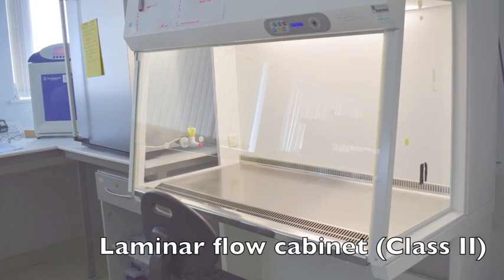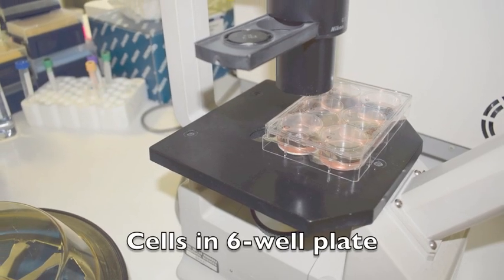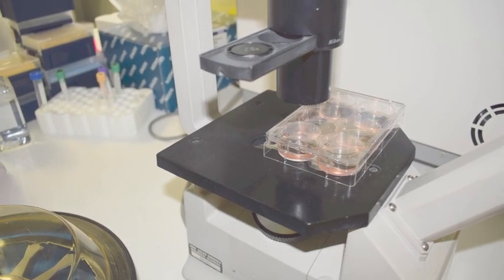Cells are cultured in a laminar flow cabinet. Cells can be cultured in six well plates.